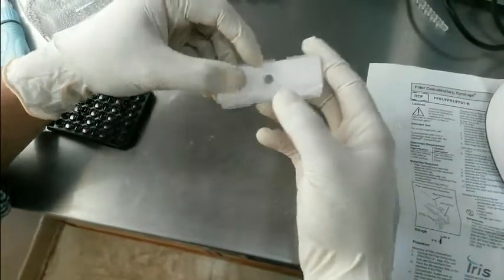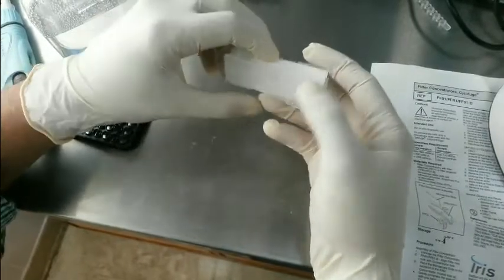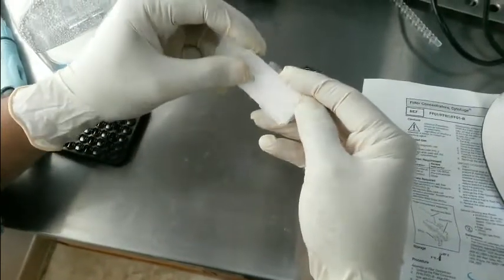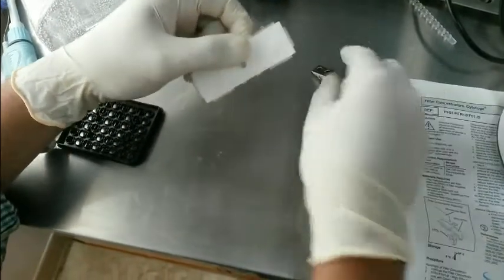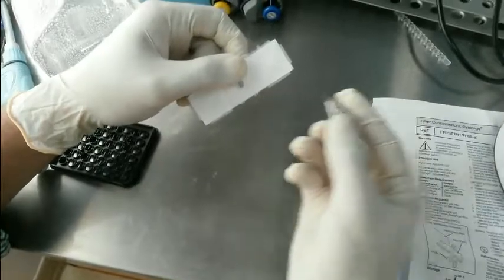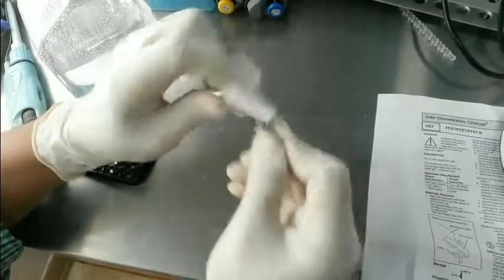After inserting the glass slide we need to close it properly just like this, and after that we need to attach a metallic clip which is provided from here.